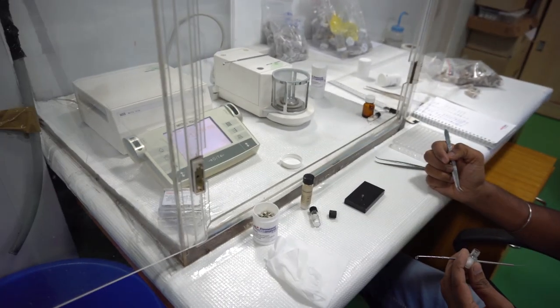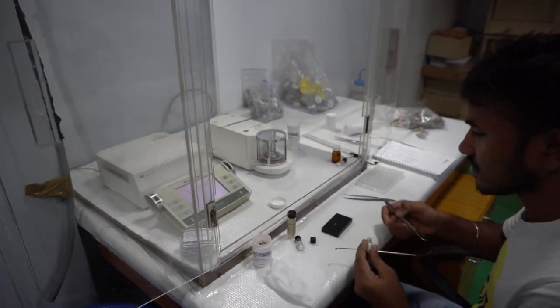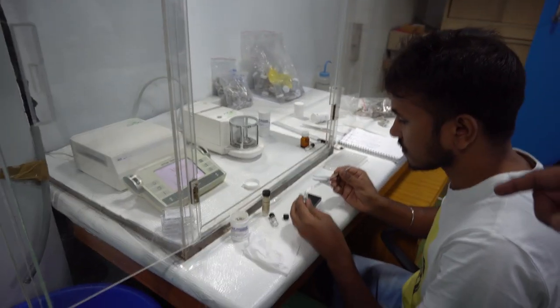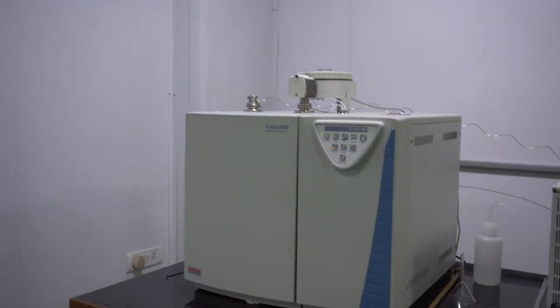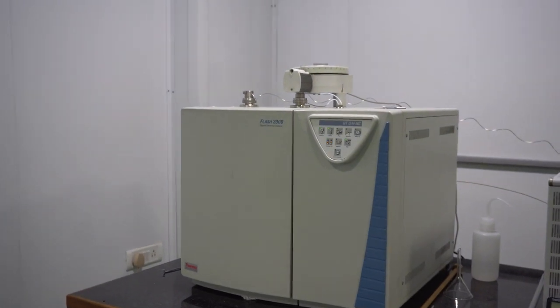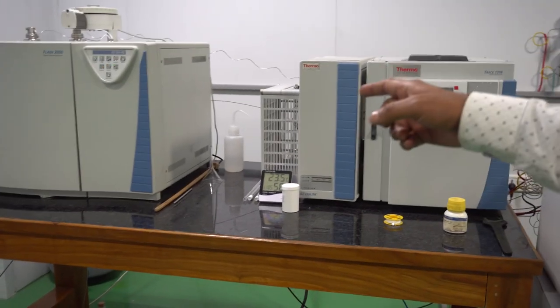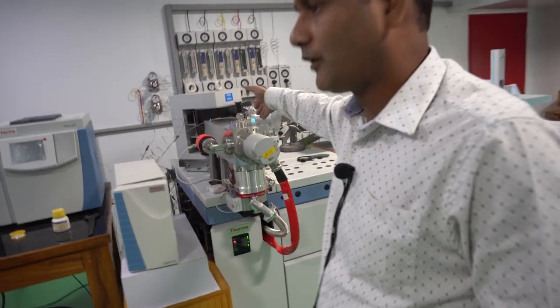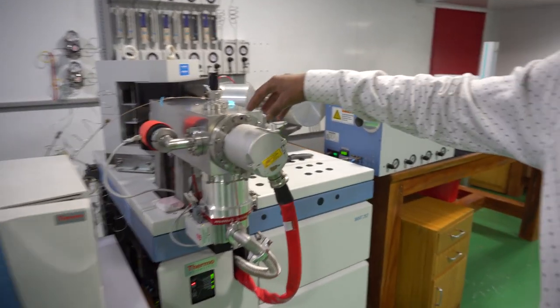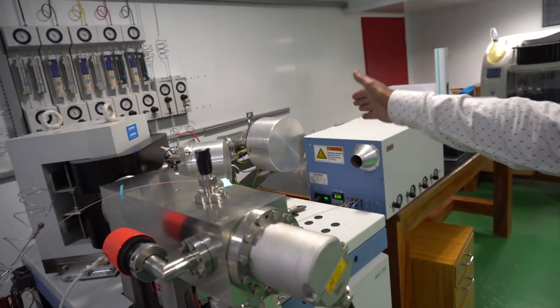We weigh our samples because along with carbon isotopic values we want to measure total organic carbon content. These samples packed in tin capsules are then introduced into the elemental analyzer. Through flash combustion all the organic content is converted into CO2 gas. Those CO2 gases pass through the reactor, water removal trap, and GC column, and finally that gas reaches the Conflo interface. From the Conflo interface that gas enters the mass spectrometer, where the gas is ionized, enters the magnetic field, and ion particles are collected in different cups.